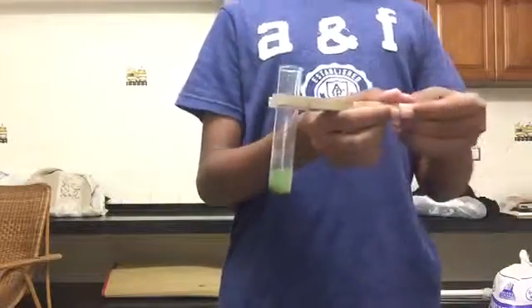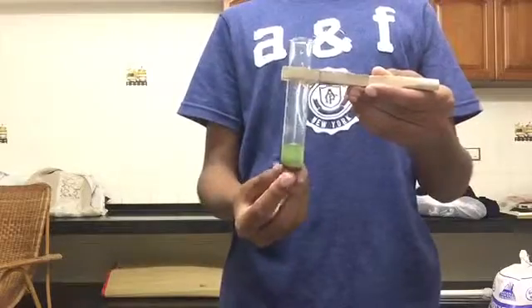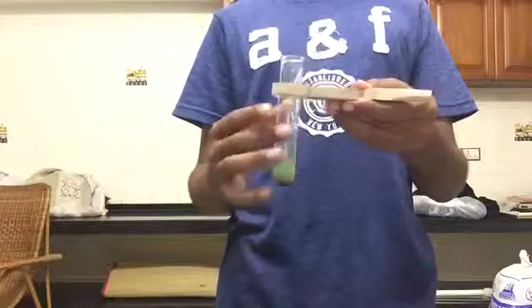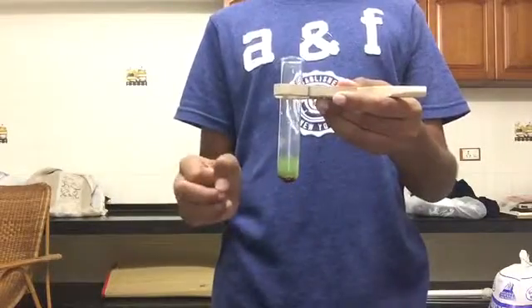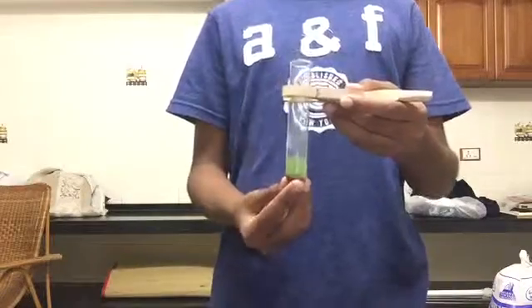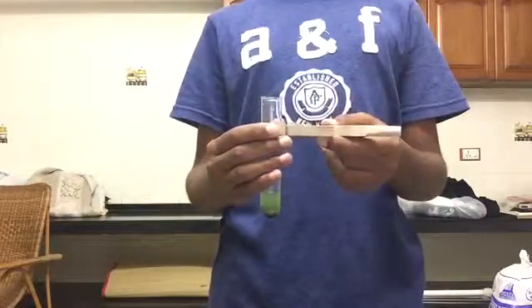You have the copper and the solution. First, you will have to filter them. The solution can be poured directly down the drain, whereas the copper has to be mixed with household garbage and then thrown out along with that. Thanks once again, and bye!